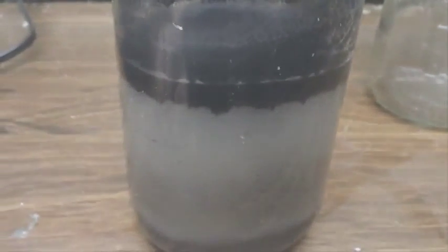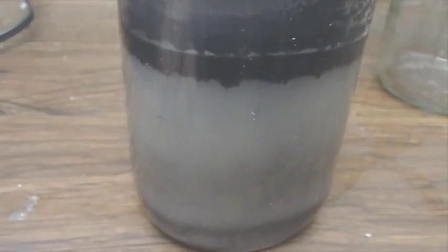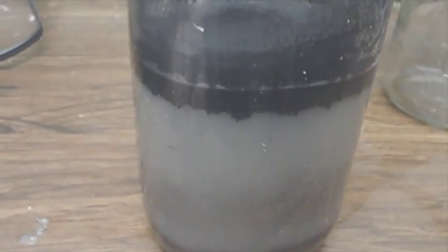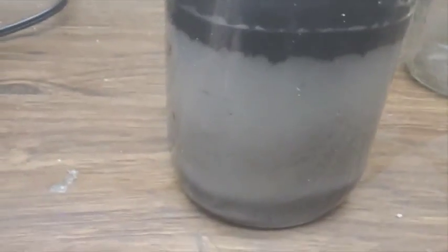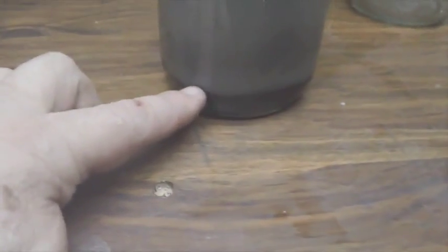Now this is acetone, and this much of it is floating on top. That's probably a good sign that it's very few layers - one, two, maybe three-layer graphene. It's clumping together and will drop as it groups together, which means this down here and a lot on top is also graphene, but it's clumped together, increasing the weight and falling down.